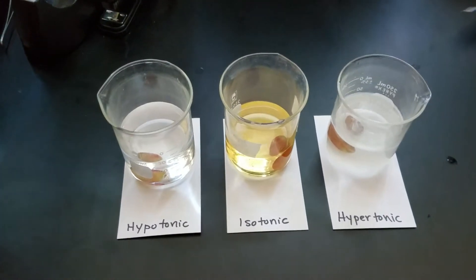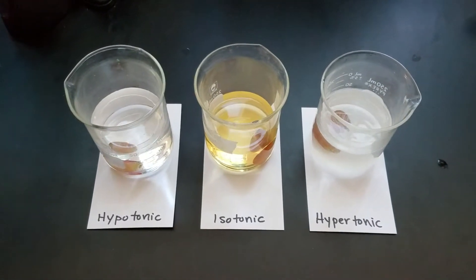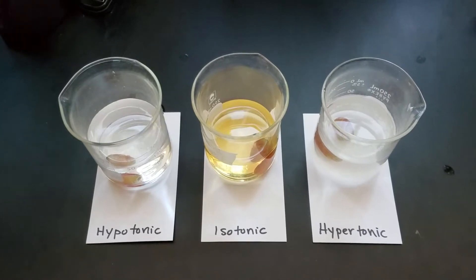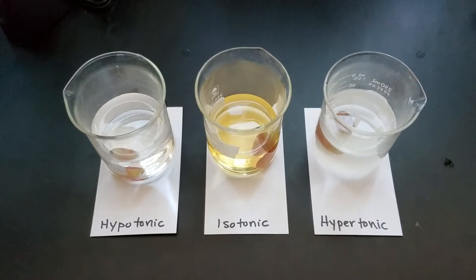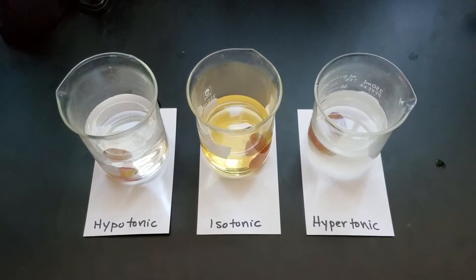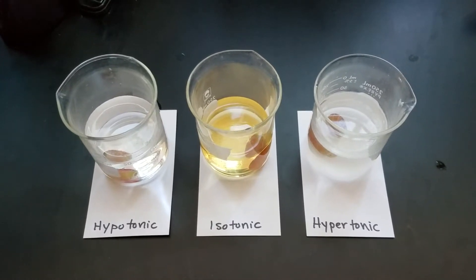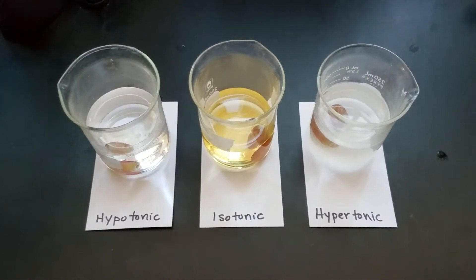For your diffusion lab, you're looking at whether the concentration is higher inside or outside the cell. Wherever the concentration is higher is where the water is going to go. I like to say water is like a party animal — it wants to go wherever the biggest party is.